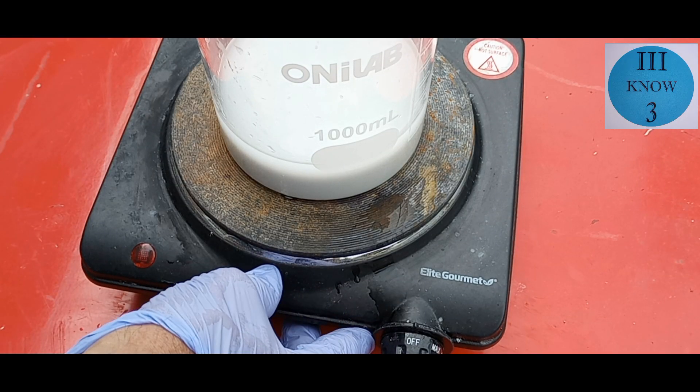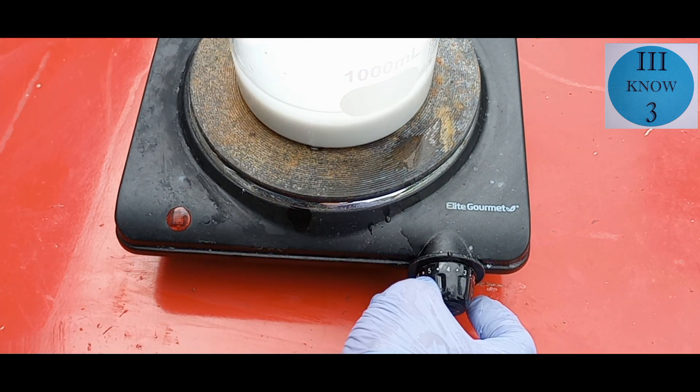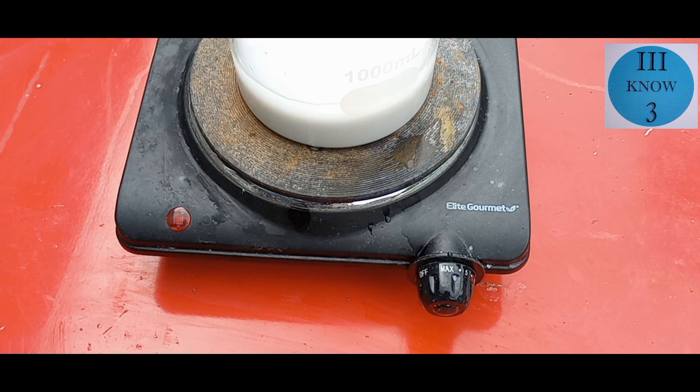Lead chloride is only slightly soluble in water at room temperature to the rate of about one gram per 100 milliliters. So I'm testing it with heat to see if it will dissolve into the water.